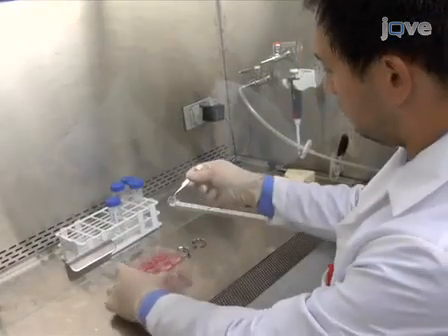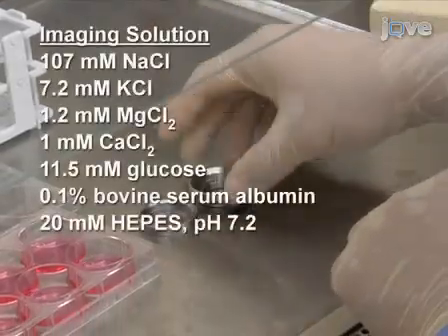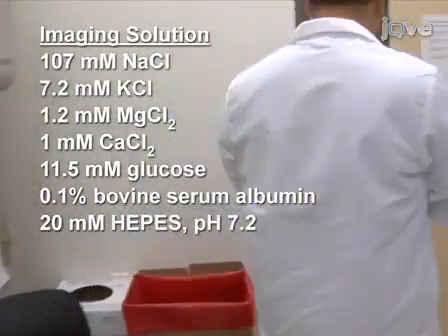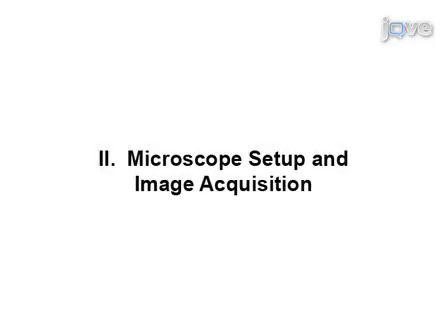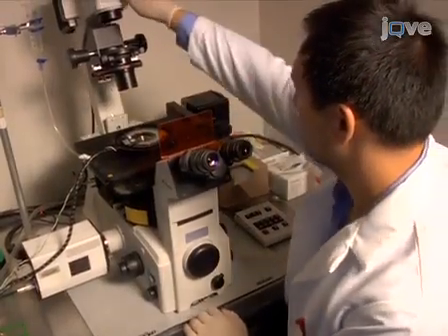Using forceps, gently place a cover slip with HeLa cells into an appropriate imaging chamber with imaging solution. Mount the imaging chamber in an inverted microscope stage.